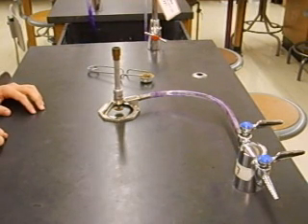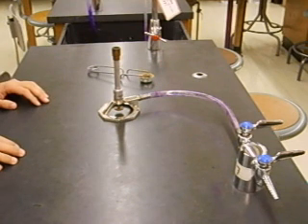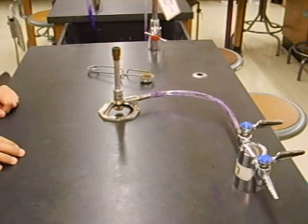All right, so what we're going to show you is the proper and easiest way to turn on your Bunsen burner. In order to do this, you're going to need a few things.